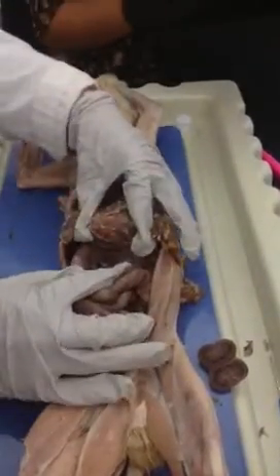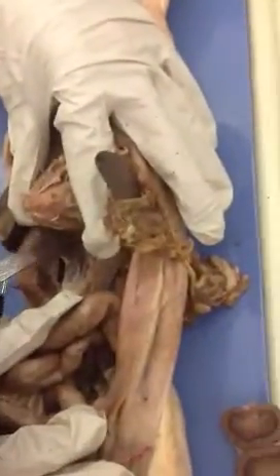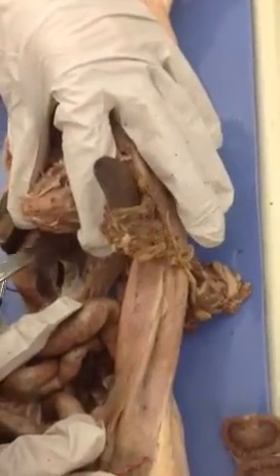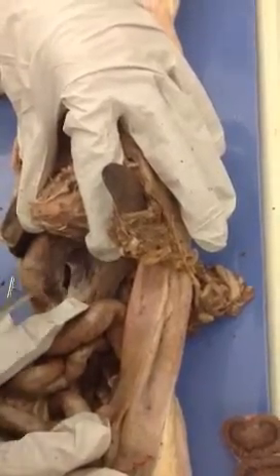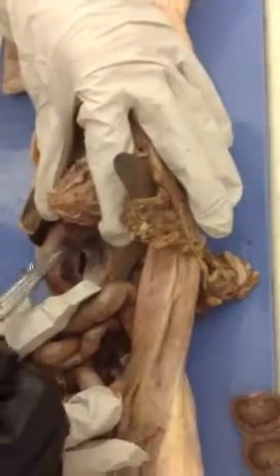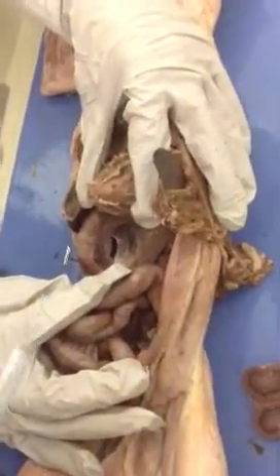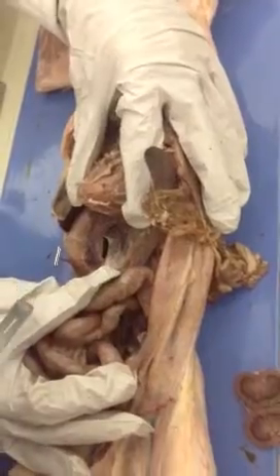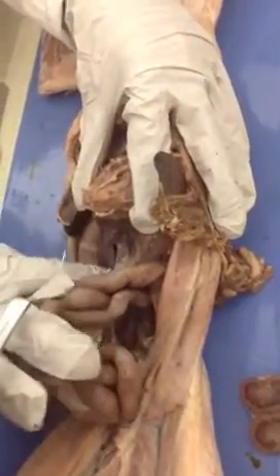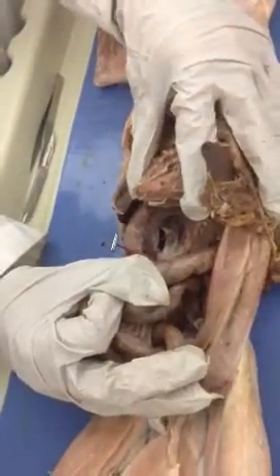Okay. So where's the pancreas? Pancreas, is it under here? And that part, and what else? It's all that, and it goes down. Right here? No. Really? No, that's the intestine. Oh, yeah, okay. Is it this over here? Nope. Oh, I got it. So it goes across this way, and it goes down. So right next to that intestine, there's pancreas. So point to the down part. Oh, this? Yep. Okay, this is all the pancreas. Yeah, all the pancreas. Okay.